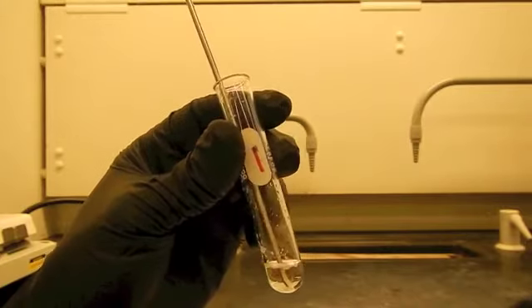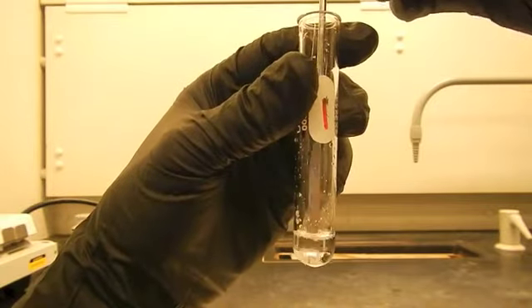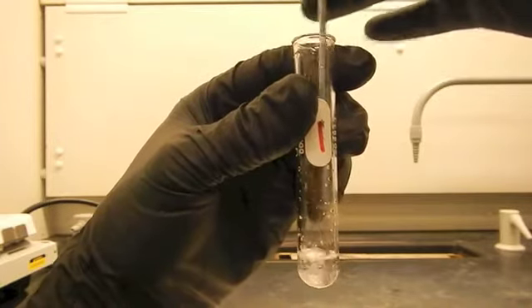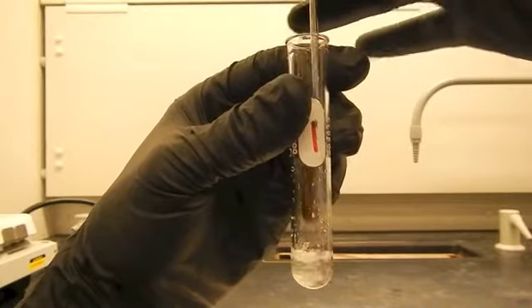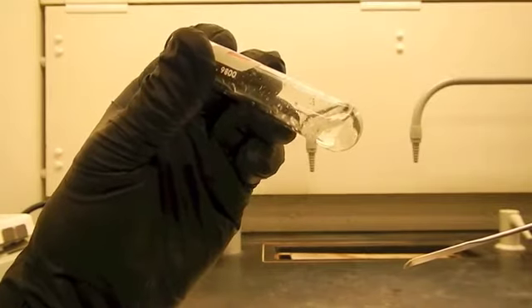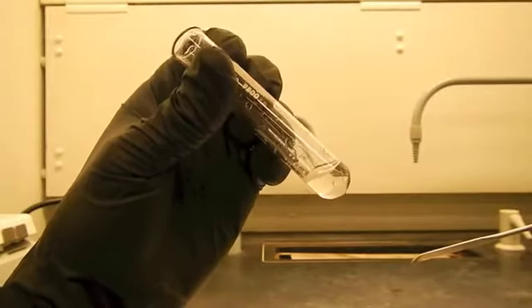Okay, so here we have test tube number 1, and I've added my 40 milligrams of benzophenone. And now what I'm supposed to do is spin my spatula in here, and this is just stirring this up for about 60 seconds. You don't want to go too much longer than 60 seconds. And at that point in time, you want to make a judgment call to say how much of that benzophenone has dissolved. Has none of it dissolved? Has some of it dissolved? Or has all of it completely dissolved?